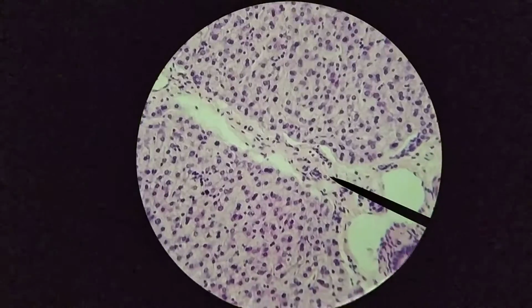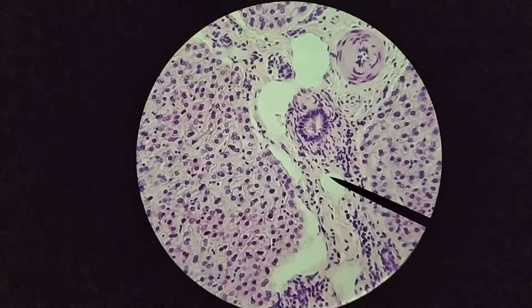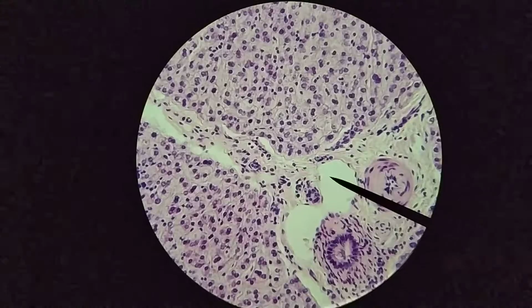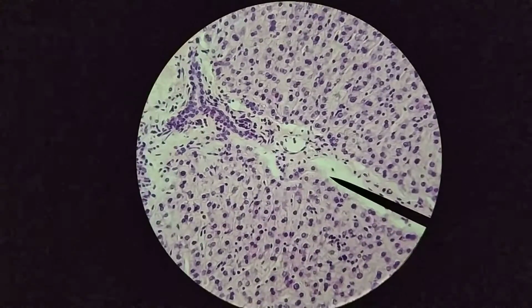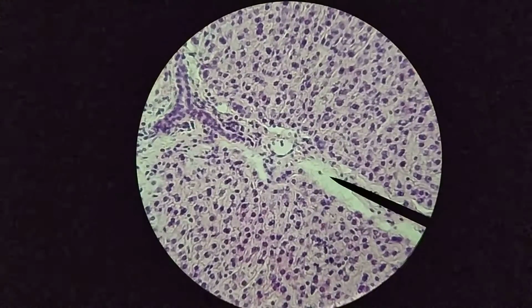And again, the arteries and veins that are found within the portal triad will branch off and run along the length of the connective tissue that separates the different lobules from one another, and so you have blood flowing not just from the portal triad but from also the areas around the portal triad, around the outside where the capsule has moved around and outlined the outsides of these lobules.